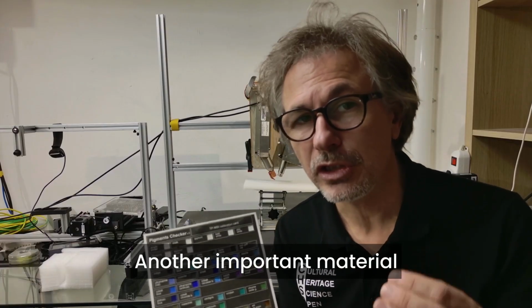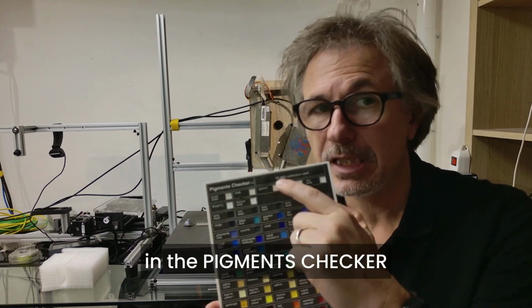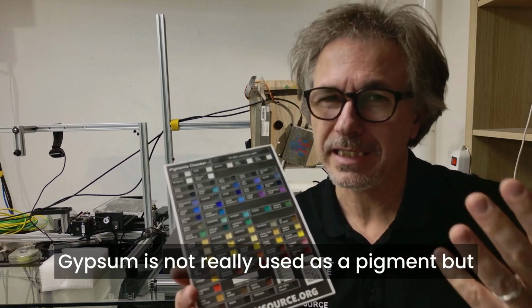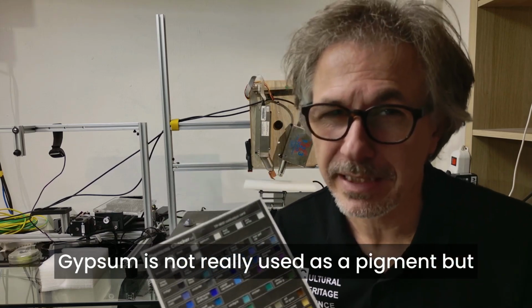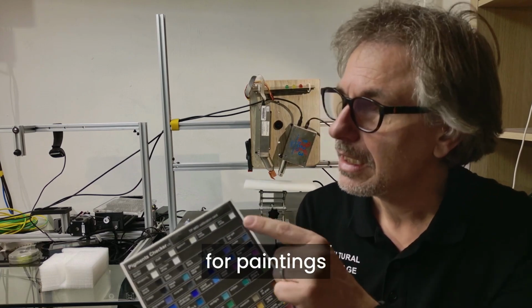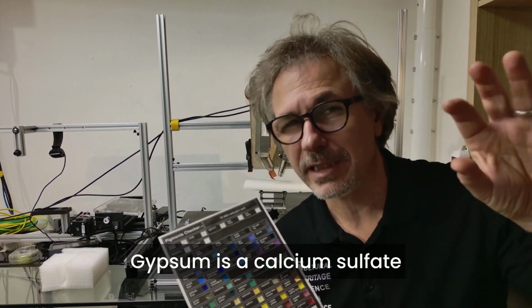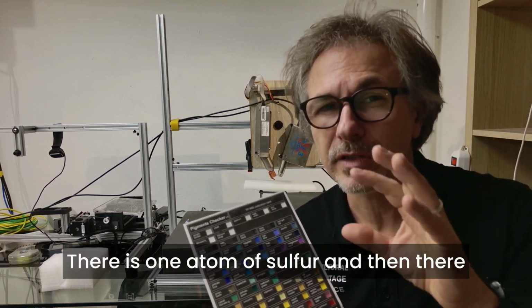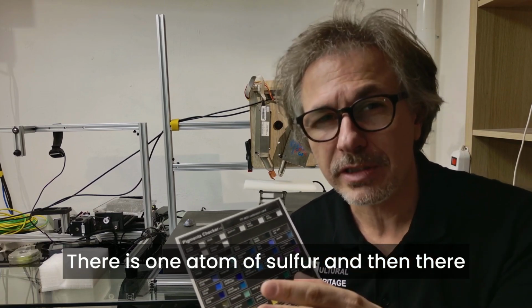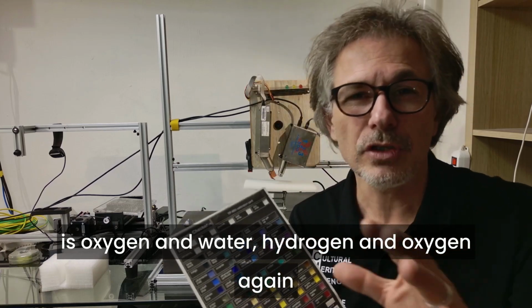Another important material that we can check is gypsum over here in the pigment check. Gypsum is not really used as a pigment, but is present as a ground preparation for paintings. Gypsum is a calcium sulfate, so there is calcium, there is one atom of sulfur, and then there is oxygen and water, hydrogen and oxygen again.